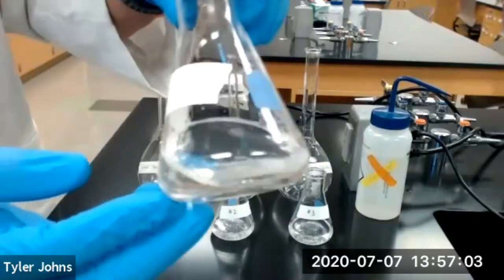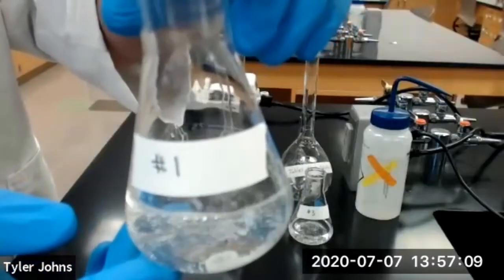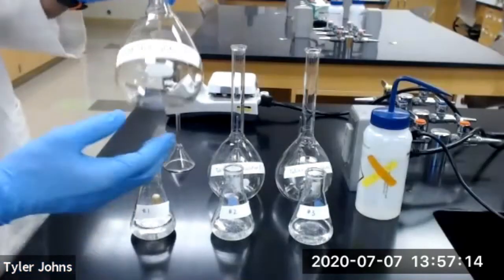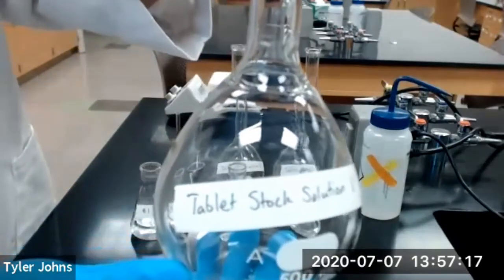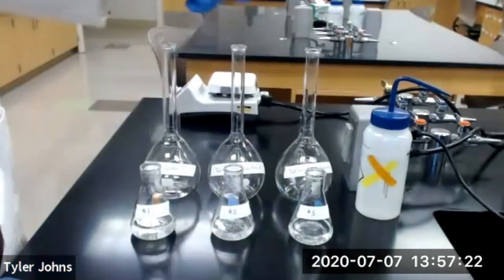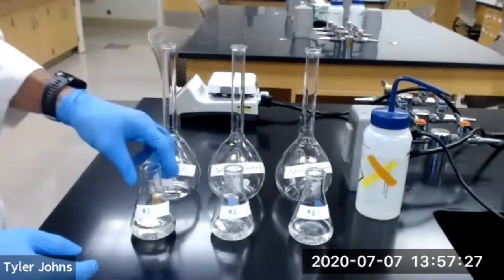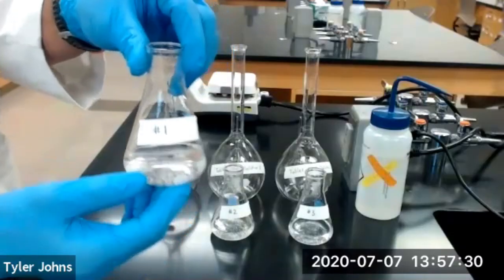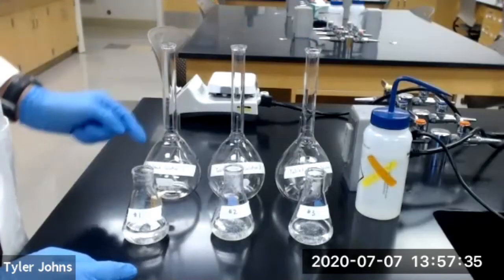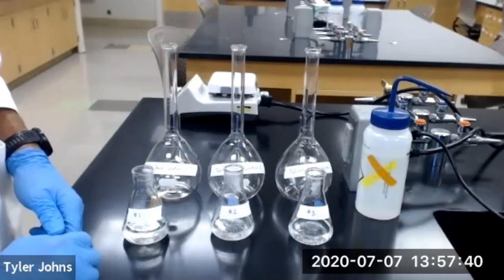You will notice that there is still some filler and starches remaining in the Erlenmeyer flask. I've also gone ahead and labeled 3 500 ml volumetric flasks as tablet stock solution number 1, number 2, and number 3. We're now going to quantitatively transfer the solution in our Erlenmeyer flask to each of our 500 ml volumetric flasks, and then we're going to fill those 500 ml volumetric flasks to the line with deionized water.